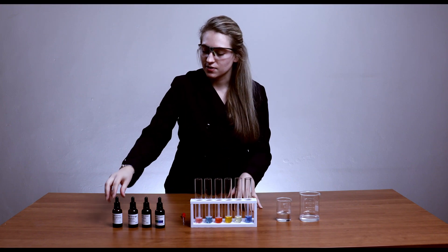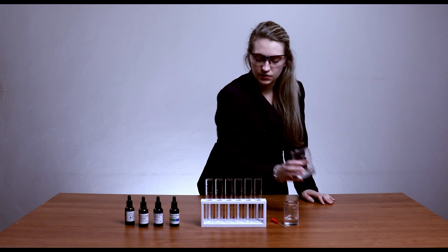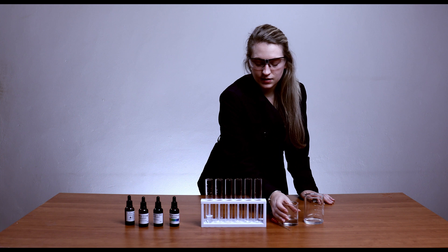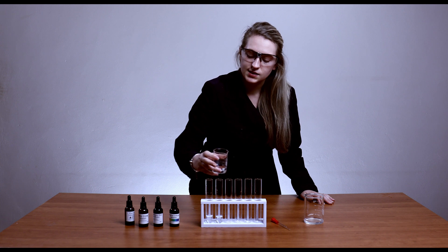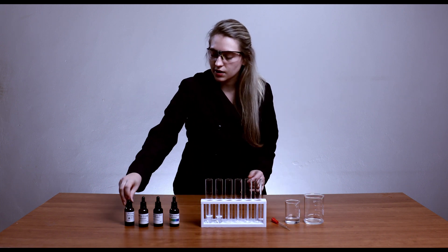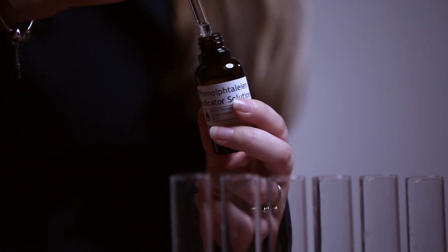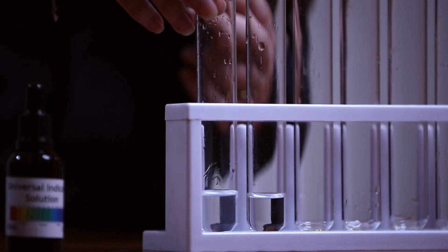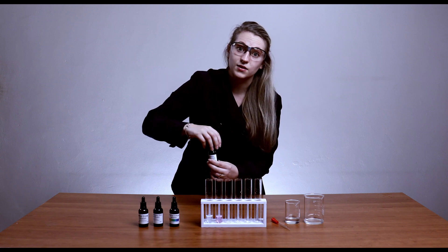Lastly, with phenolphthalein it should go colorless in an acid and dark pink in a base. This is my sodium hydrogen carbonate and here I have my citric acid. You can see it doesn't change color in the acid, so it remains colorless, and in the base it goes pink. Remember it's not going to go dark pink in this case because it's a very weak base.